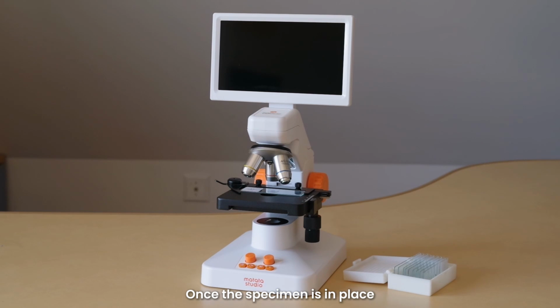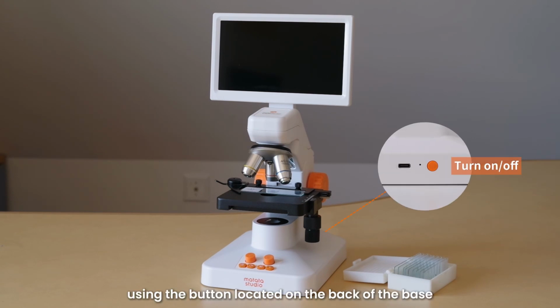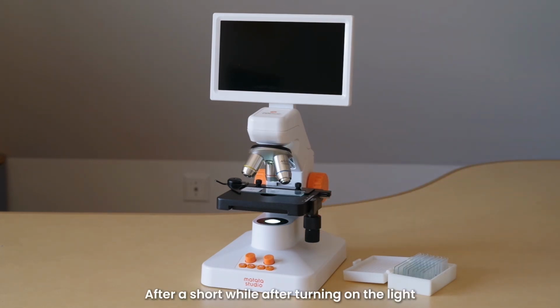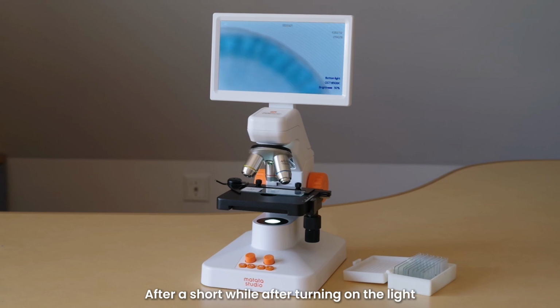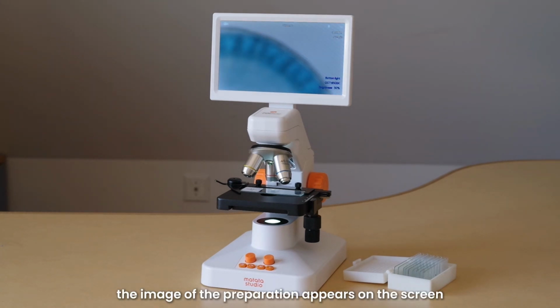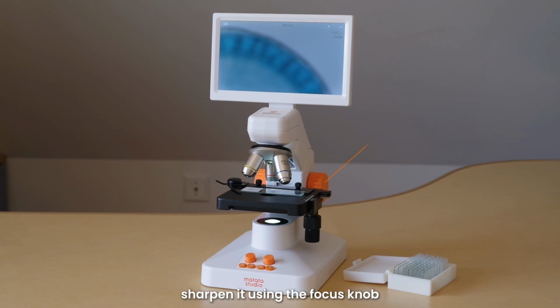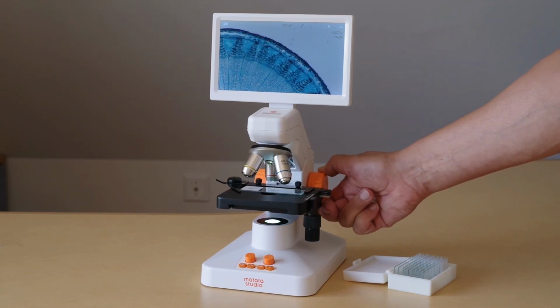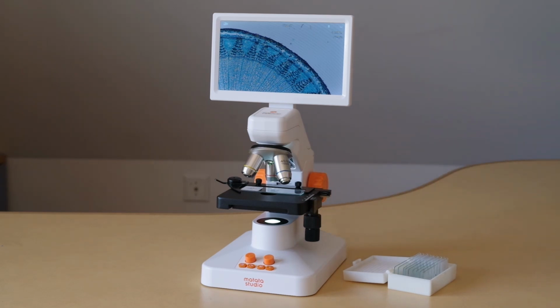Once the specimen is in place, we turn on the microscope lighting using the button located on the back of the base. After a short while, after turning on the light, the image of the preparation appears on the screen. When the image is out of focus, sharpen it using the focus knob. If the image on the screen is too bright or too dark, we can adjust it to our own requirements.